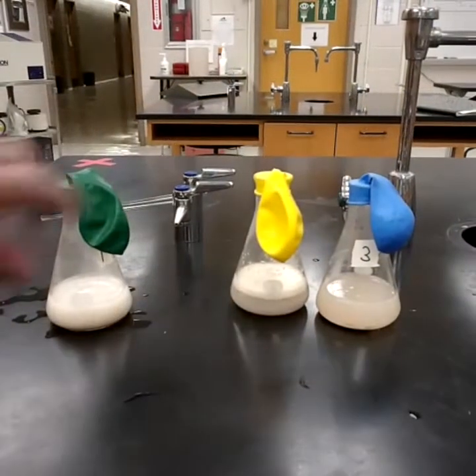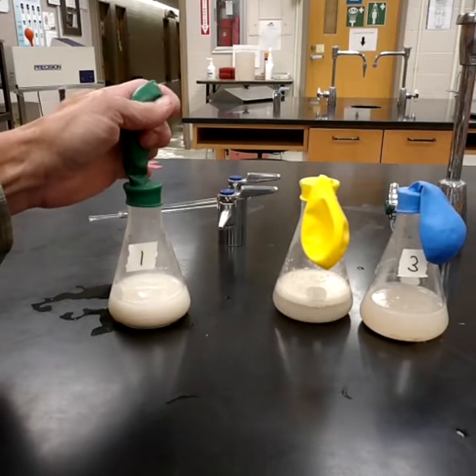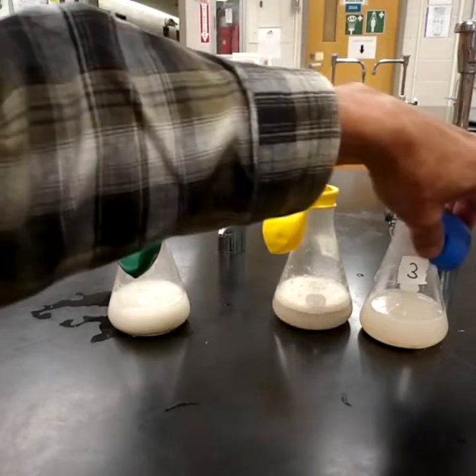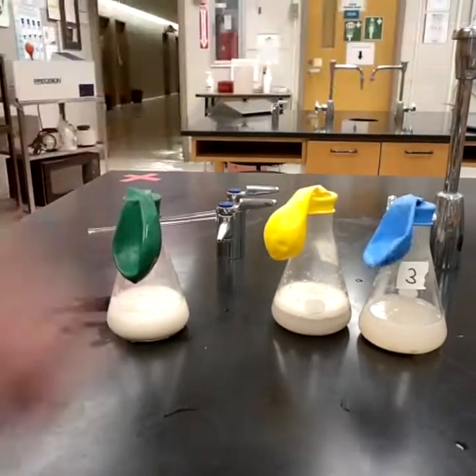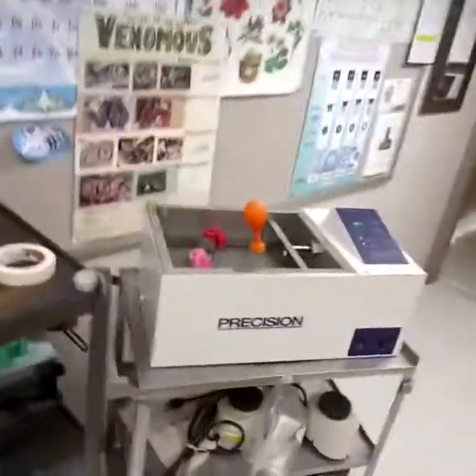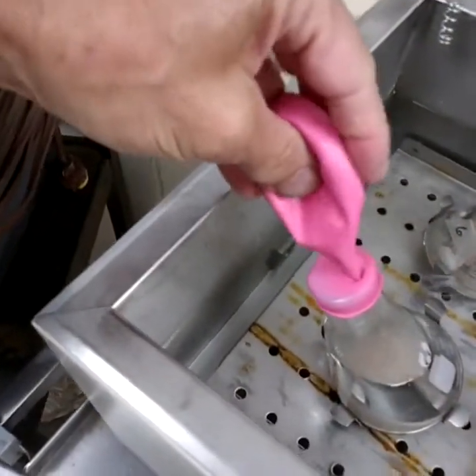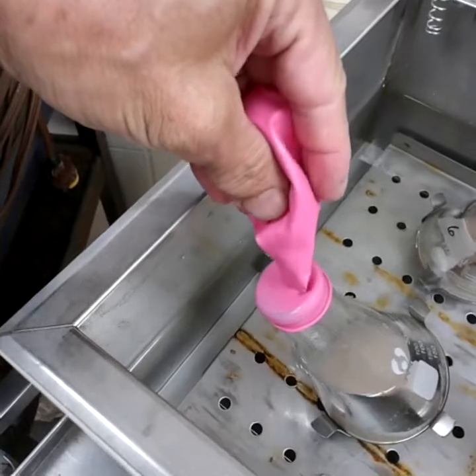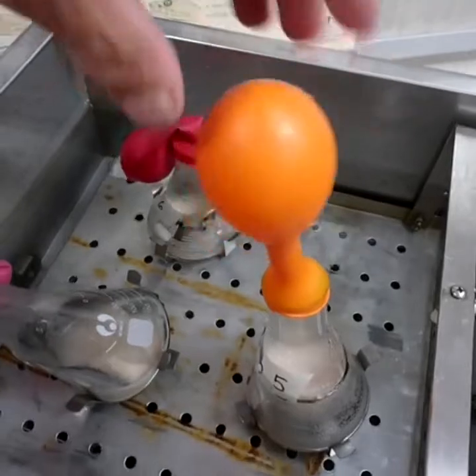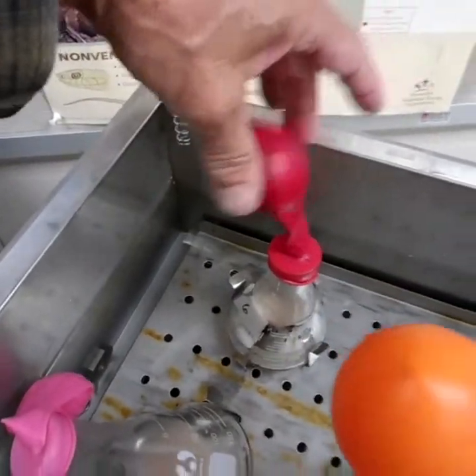All right, this is after 15 minutes. Flask number 1 didn't change really anything significant. Flask number 2, there's a little gas in there. It grew a little bit. Flask number 3, not much change yet. Let us go to 4, 5, and 6. Let's see, 4. Yeah, a little bit. Of course, this might have expanded a bit too. I don't expect much to happen in 4, but a little. Ooh, 5. 5 is cranking up there. It's starting to inflate the balloon. And 6 has a bit of gas in it as well.